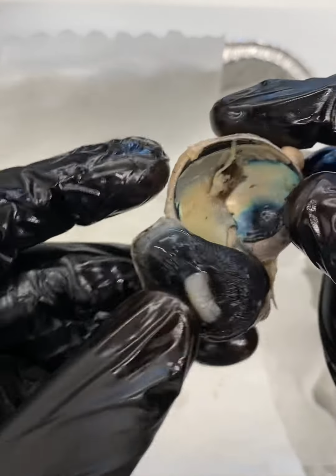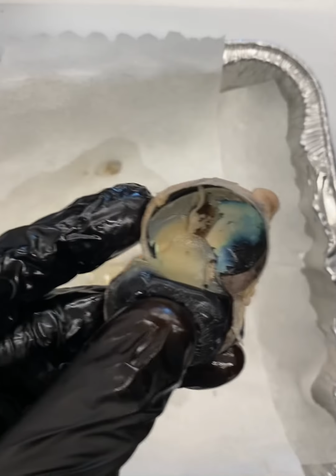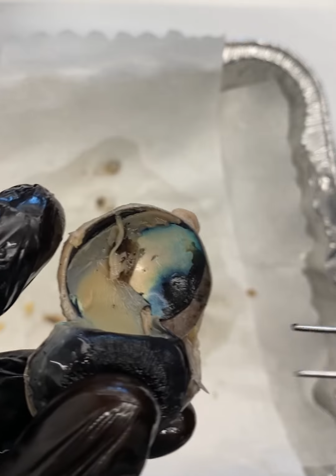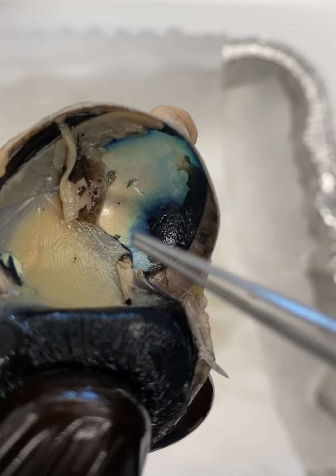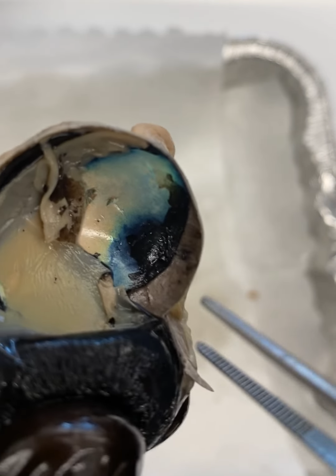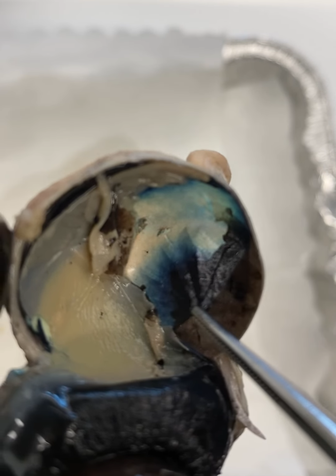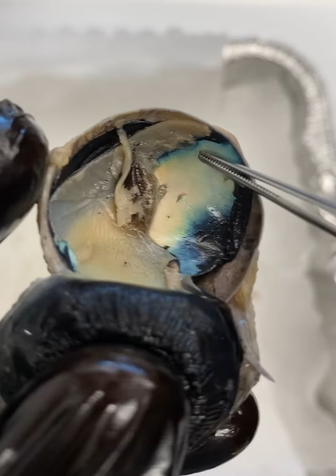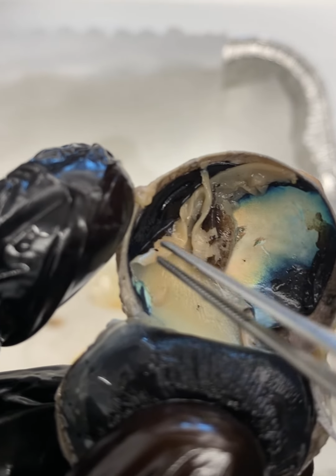Now, this is a sheep eye. This is not a human eye. So they, and other vertebrates, other mammals, have a structure that we as humans do not have, called the tapetum lucidum. That's this kind of blue-green structure that you see all in here, and it's essentially part of this choroid layer. You can see it's all one layer if we start to peel on it. If we peel part of the retina away, you can see part of it over there as well.